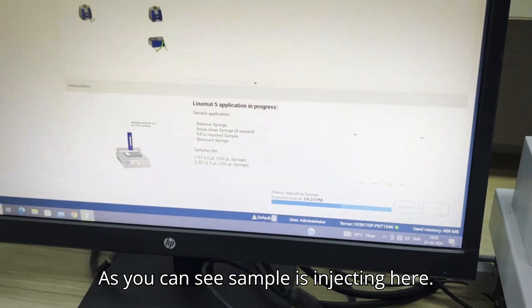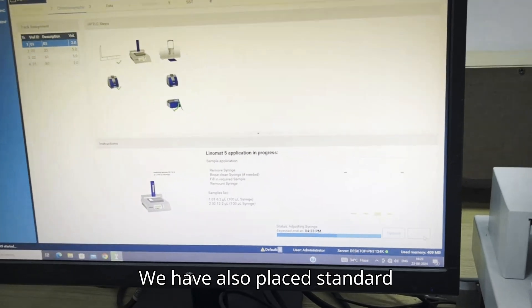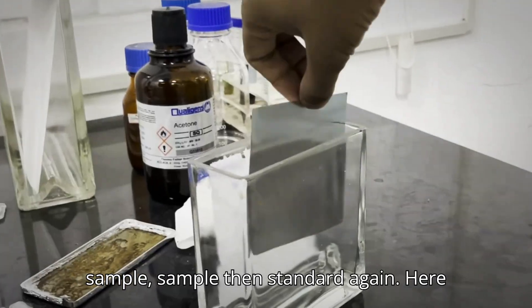As you can see, sample is injecting here. We have also placed standard, then sample, sample, then standard again.